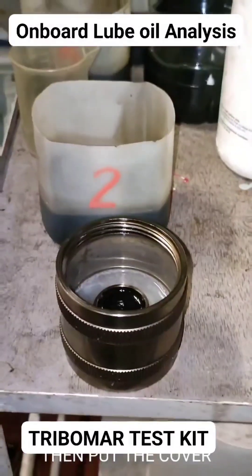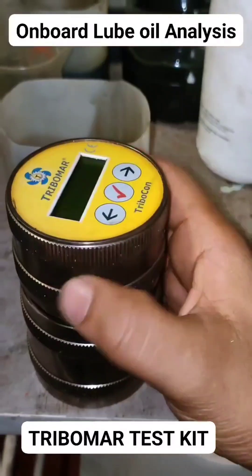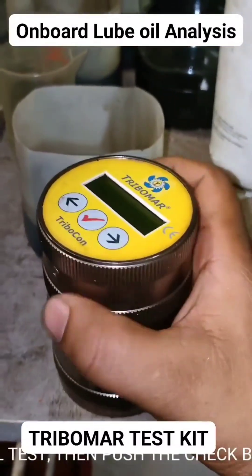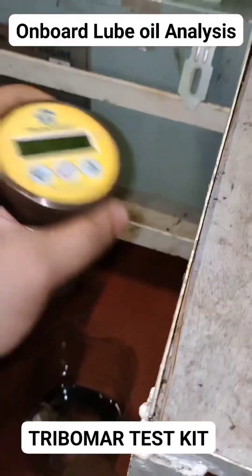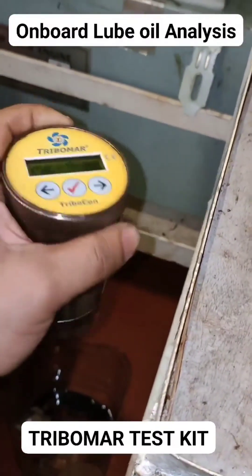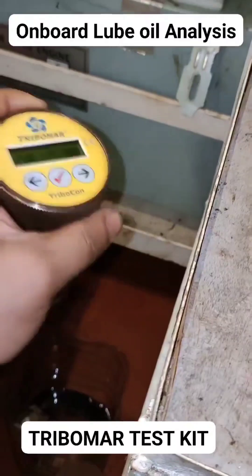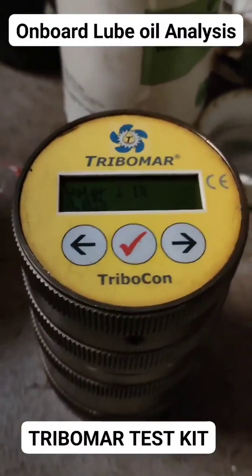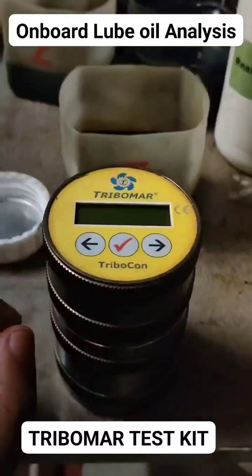Put the cover on the analyzer. Set the analyzer to whatever you want to analyze, such as total base number (TBN) or water and oil test. Then push the check button to start analyzing, then shake the analyzer until the countdown finishes, and record the result.